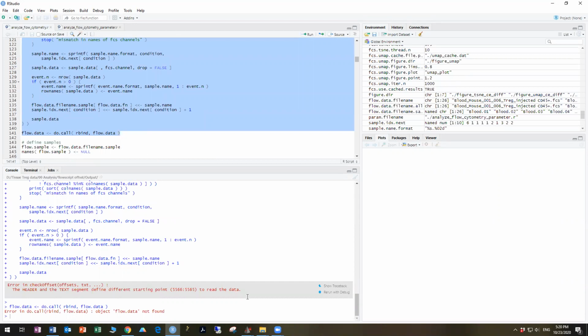So the header and text defining different starting points. So basically what FlowJo has done is it's created an FCS file in which the number of actual cells in the FCS file doesn't match with the structure file of the file that says that it contains a certain number of events. So typically it's just off by 1, which is pretty annoying, but it fails the quality check. And the easiest thing to do is just to remove that data file from your analysis.